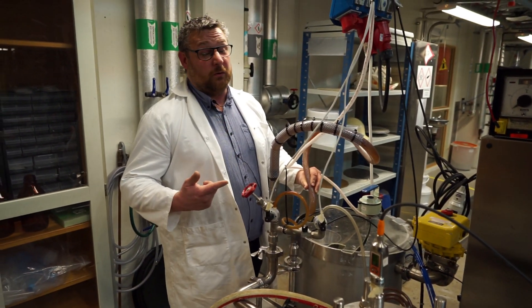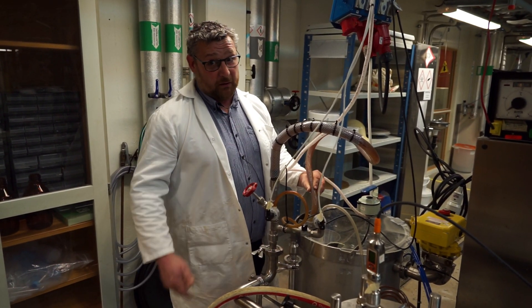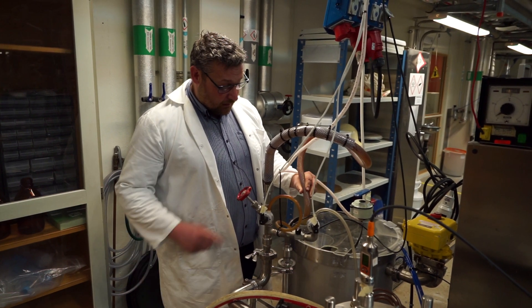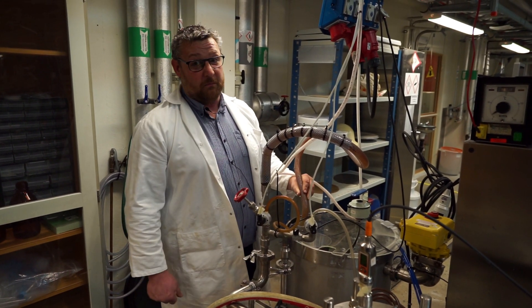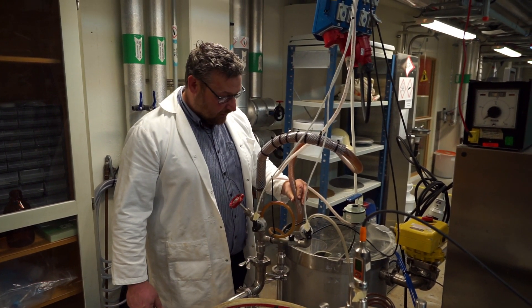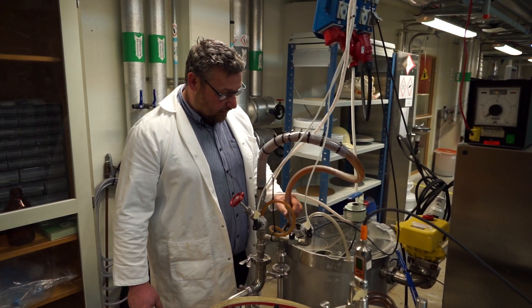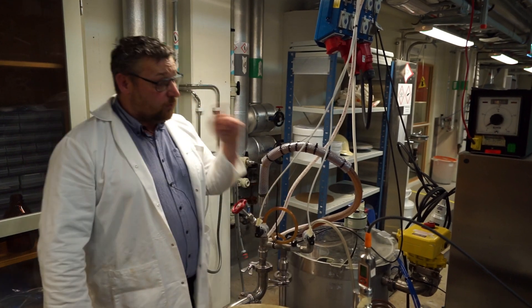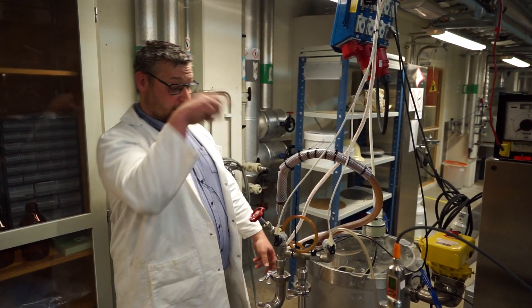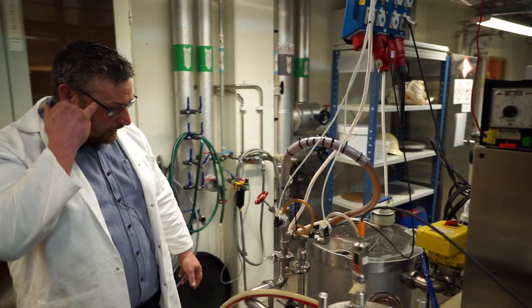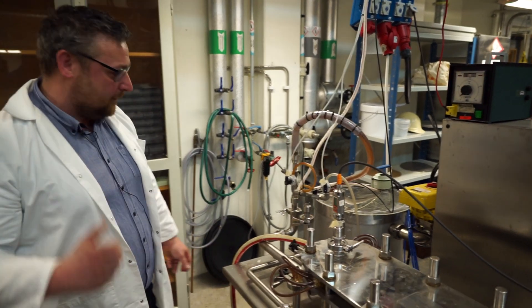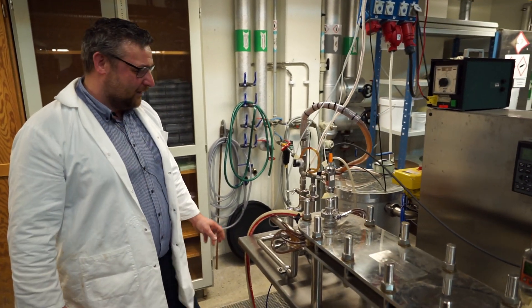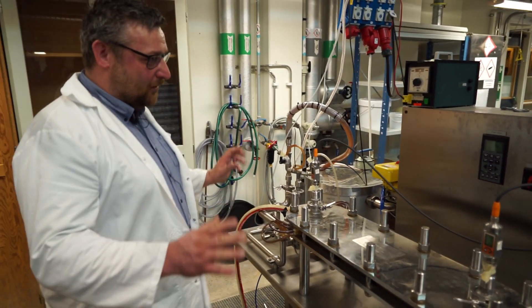You can imagine, if I were to go to 50 Hz, which is normal speed for a pump, this would be much more violent. But that being violent, it also is a risk that that hose would start doing this, and then we would be wet, and everyone would be sad. Another reason to have lab coats.